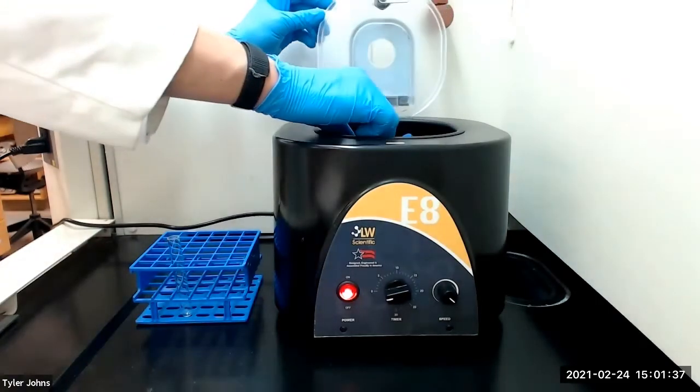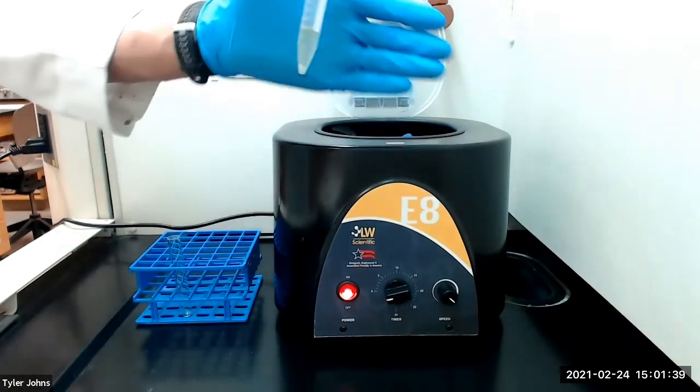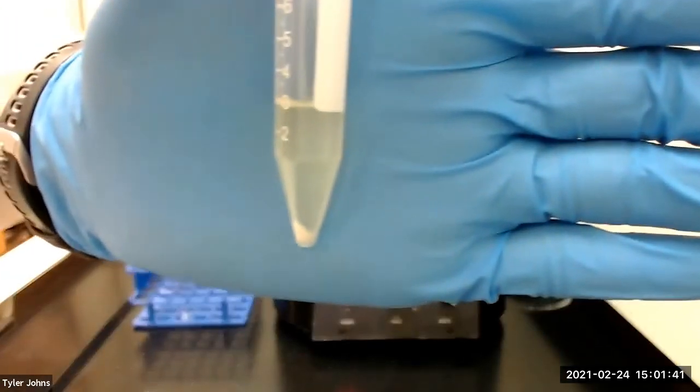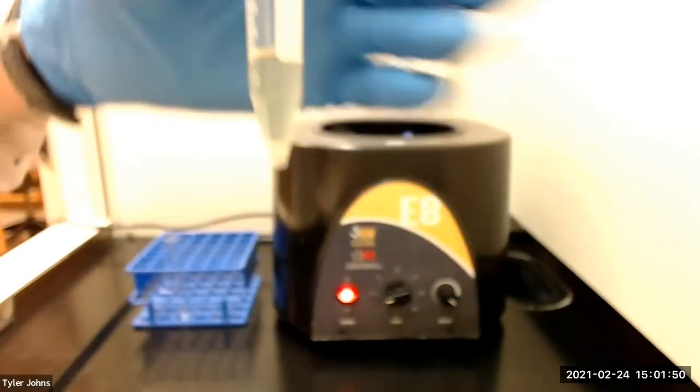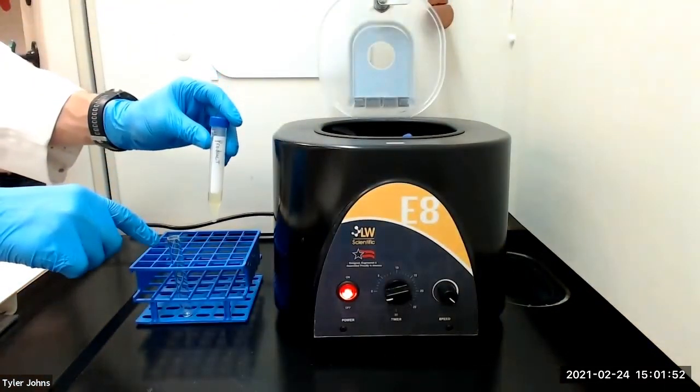This is what the acetone extract looks like after centrifugation. We will next transfer the clear acetone extract to the pre-weighed test tube.